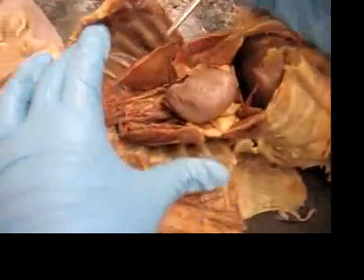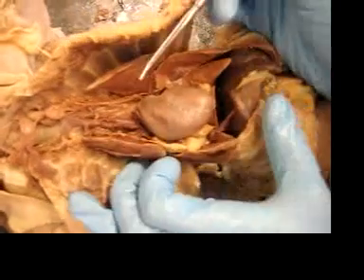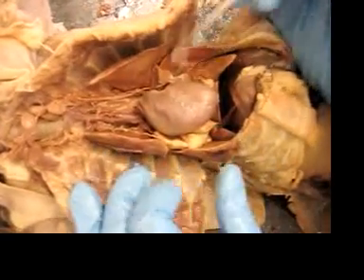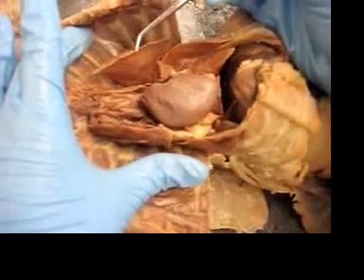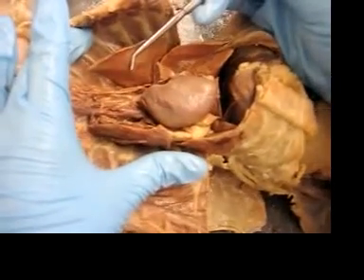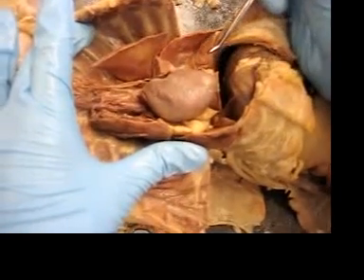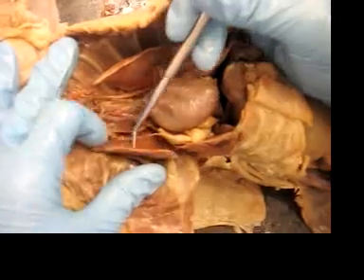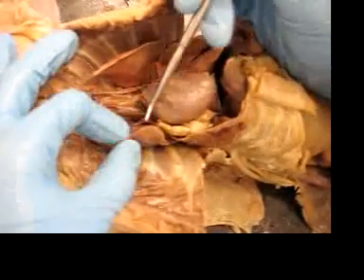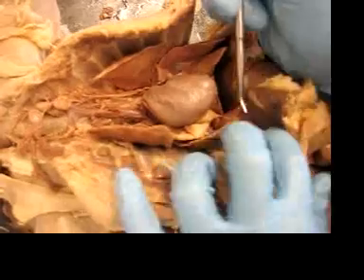Looking at the respiratory and circulatory systems — this is all lung, the different lobes of the lung. Here's the left anterior lobe, the left middle lobe, and the left posterior lobe of the lung. And the same for the right: here's the anterior, the middle, and the posterior down there.